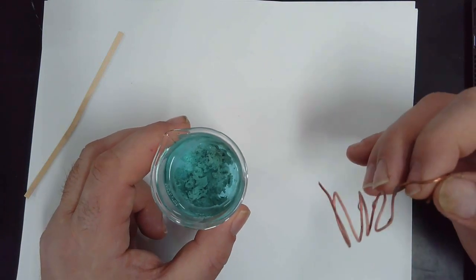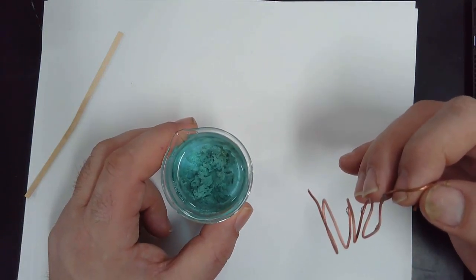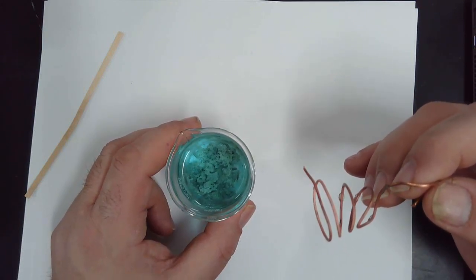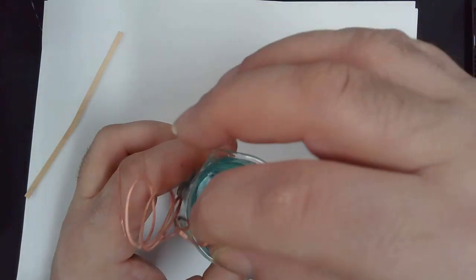Then you will put the beaker back where it was overnight so it can dry for the weekend. Does everyone understand that? Are there any questions, any problems? Then pitter patter, let's get at her.